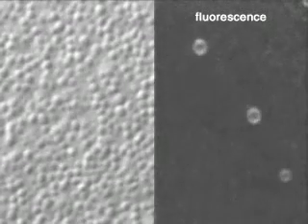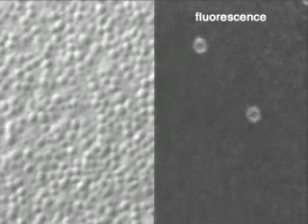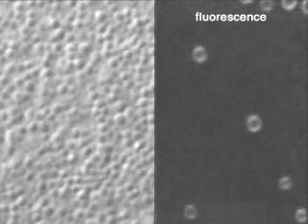Exocytosis can be visualized directly in this system. For this purpose, the plasma membrane is labeled with a fluorescent dye, seen on the right. Each time a vesicle fuses, it leaves a depression in the plasma membrane, which, in the optical section shown, appears as a ring of increased fluorescent staining.